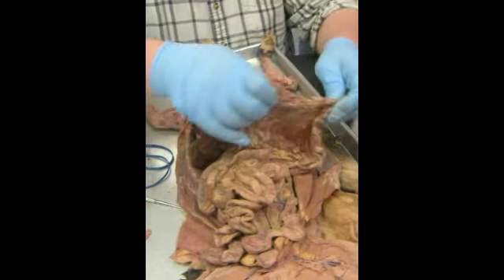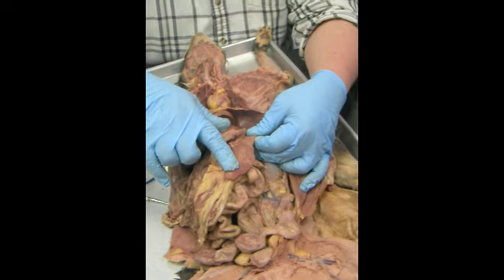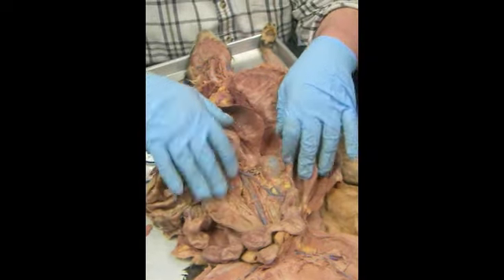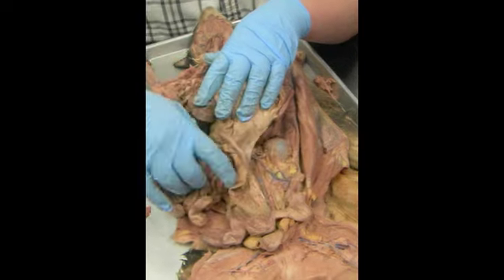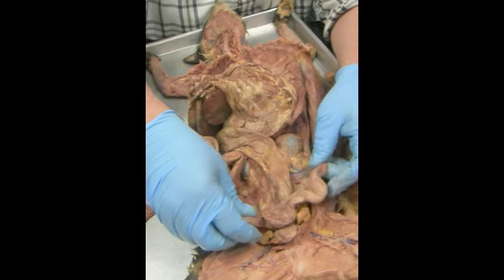Okay? If we pull this down, this large organ that looks like a dog's tongue is the spleen. If we move everyone over, we now have a large intestine. Ascending, transverse, descending, sigmoid. It's a female cat, so we have an ovary and uteri.